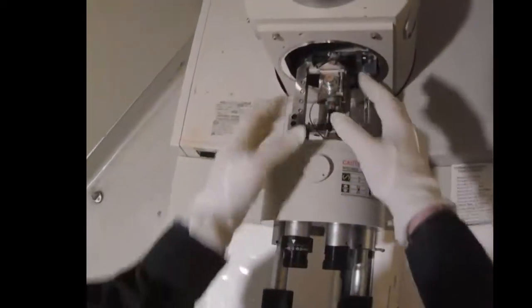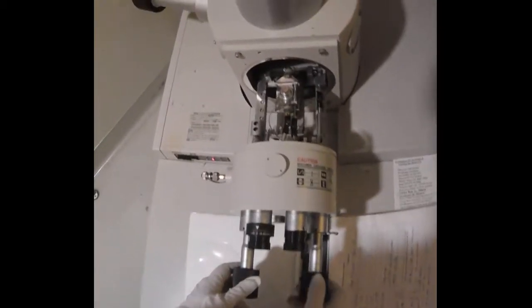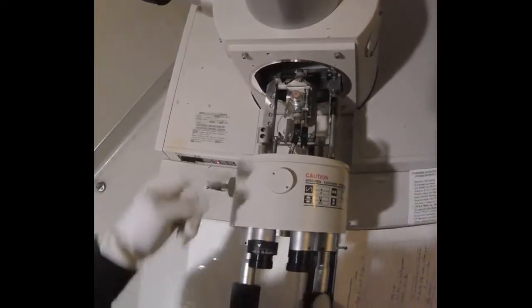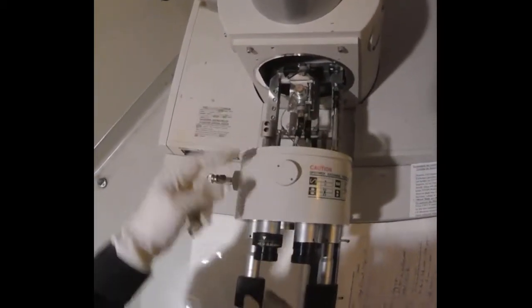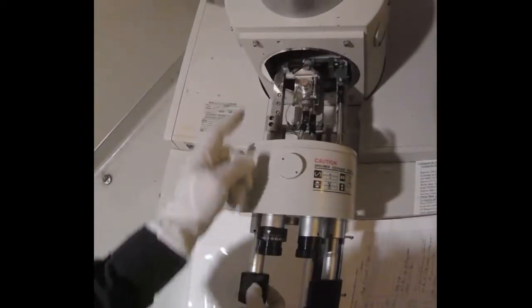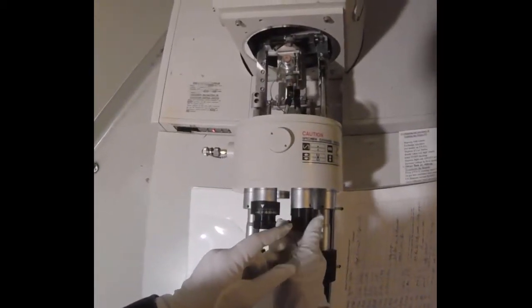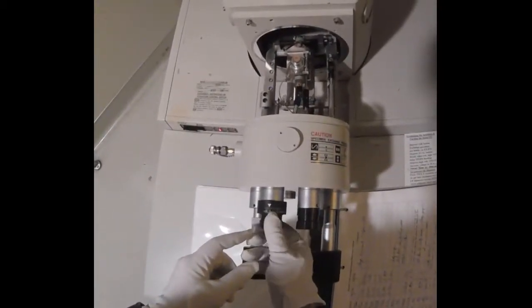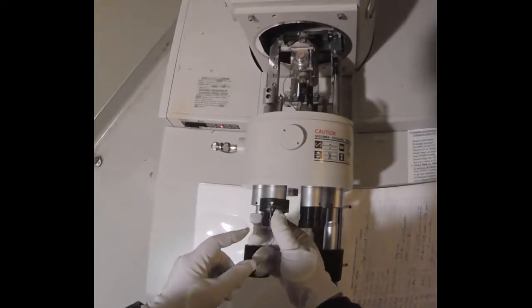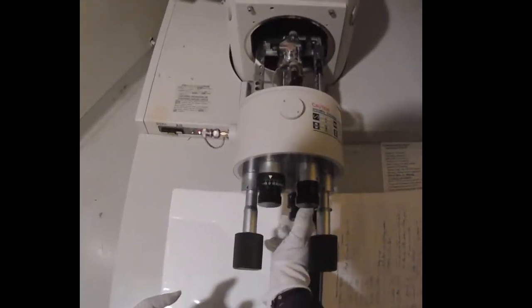And all these controls here allow us to change the sample position. So I'll illustrate. This moves the sample in the x direction. This moves the sample in the y direction. This rotates the sample. This tilts the sample. And this one raises and lowers the sample.